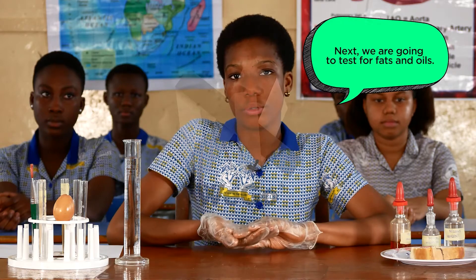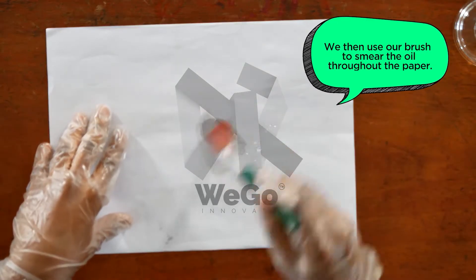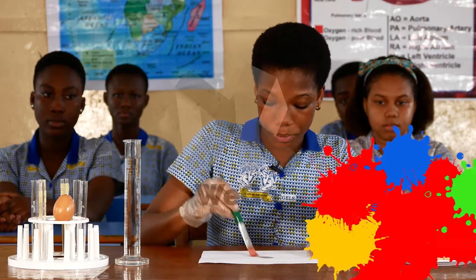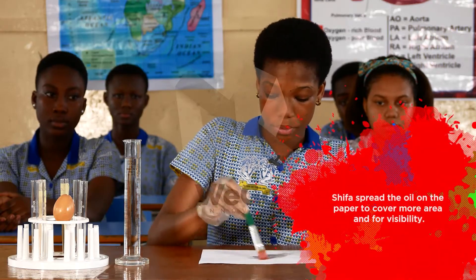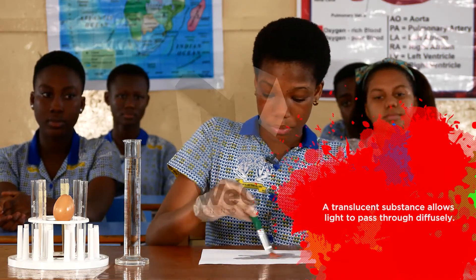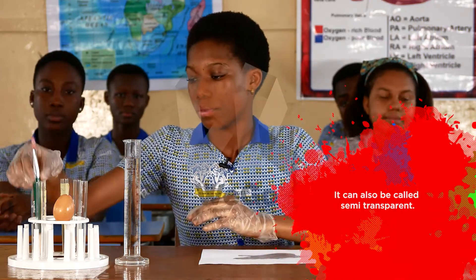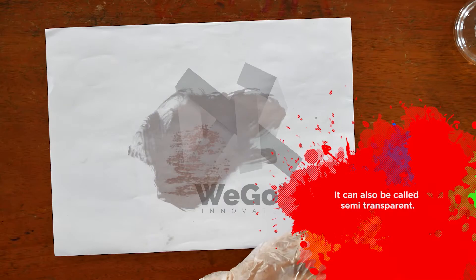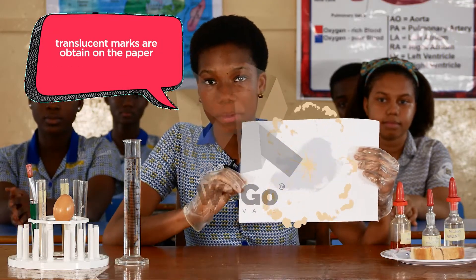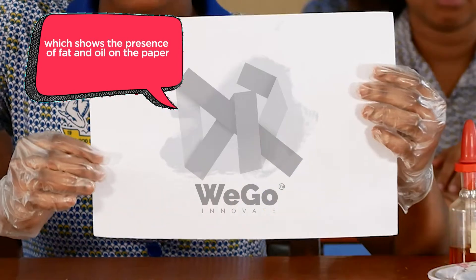Next, we are going to test for fats and oils. We pour the oil onto the paper, then use a brush to smear the oil across the paper. Shifa spread oil on the paper to cover more area for visibility. A translucent substance allows light to pass through diffusely — it can also be called semi-transparent. After smearing, translucent marks are obtained on the paper, showing the presence of fats and oils.